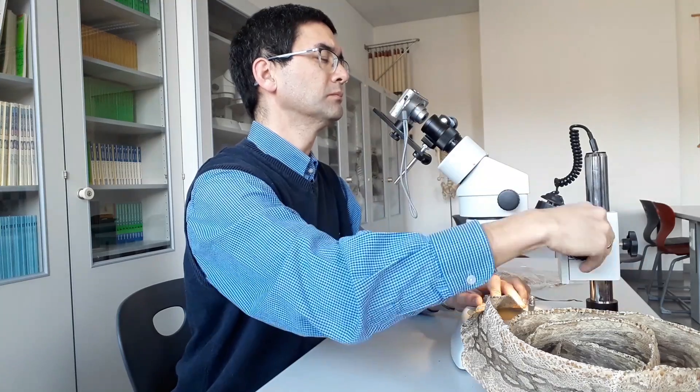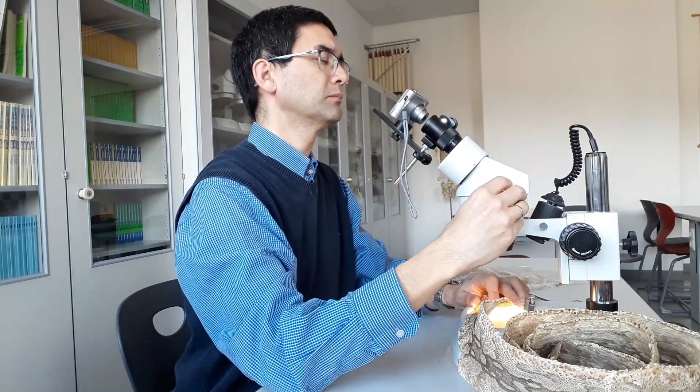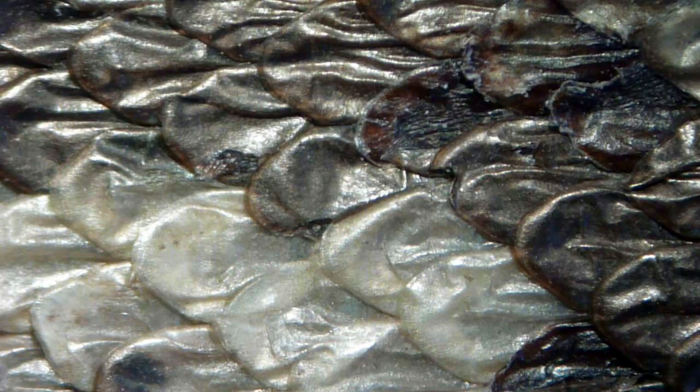Here I'm making adjustments to the camera. I'm using the screen of the camera to do microscopy, so I'm getting a live image as well. That's a photograph. That is another location of the snake leather. That's a photograph using the bottom illumination.